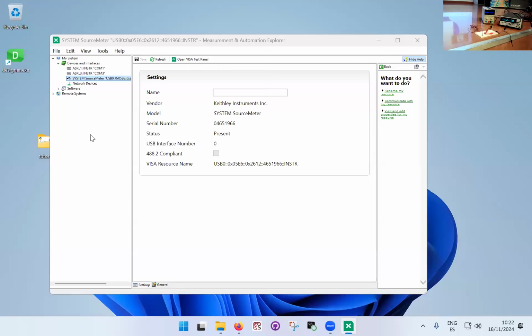You have to interact with it, and the interaction is text-based. So you have to send messages to the instrument, and you have to read what comes back from the instrument. The utility to do this comfortably. So if you don't mind, I'll sit, because I'll be typing things as we go along. So in this case, what we want to see is if the instrument is talking to the computer, or is able to talk to the computer.